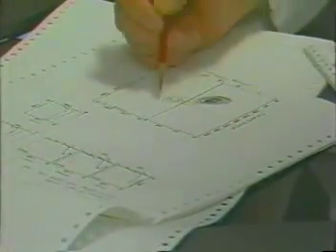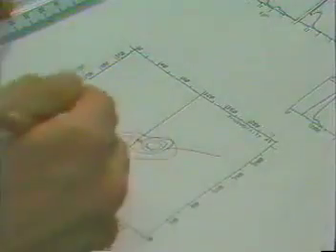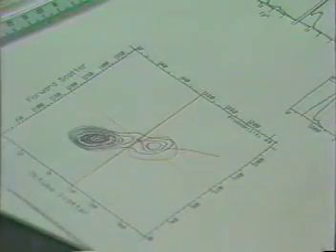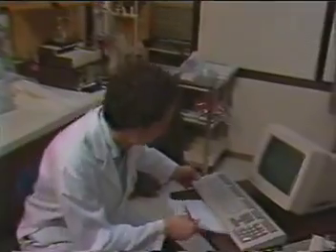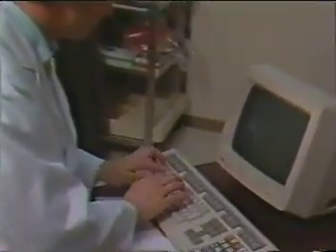Using the scales along the edge of the scatter map, Tom determined the numerical values of the boundaries he had drawn. By entering these limiting scatter gates into FACSDesk, he obtained contour maps showing red versus green staining patterns, mainly for the lymphocytes in his samples.